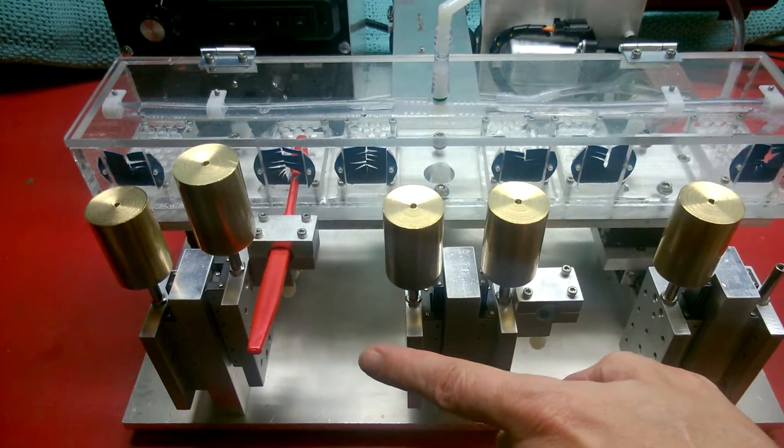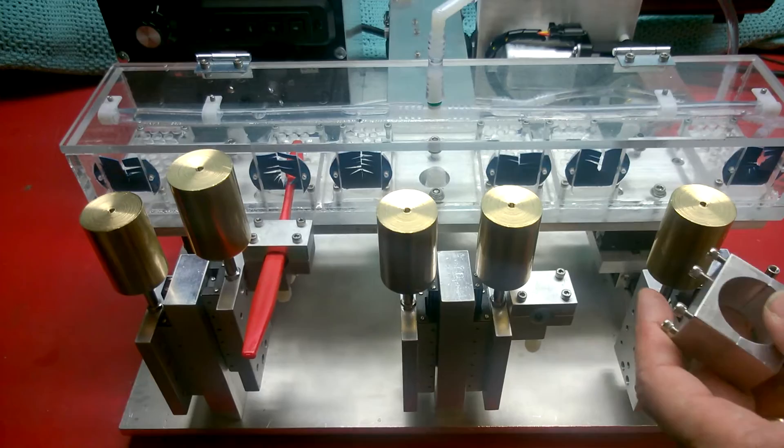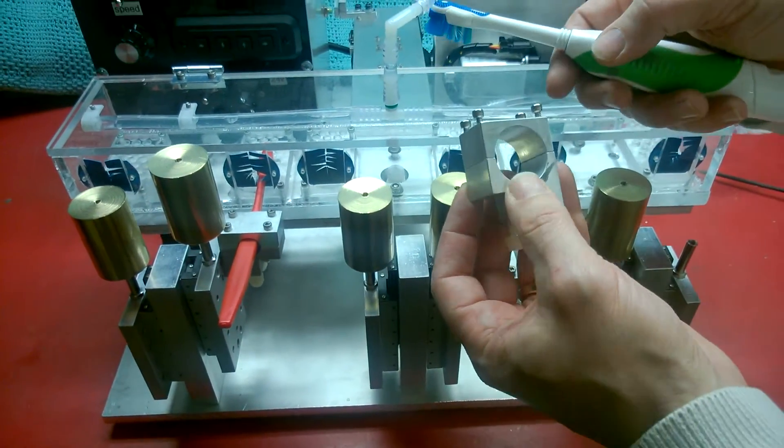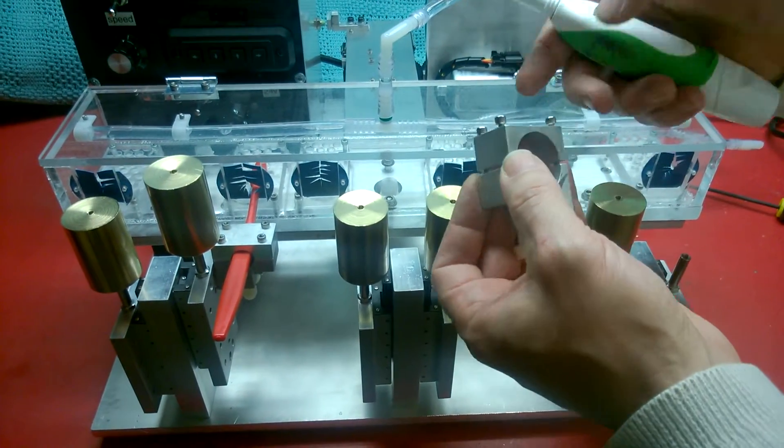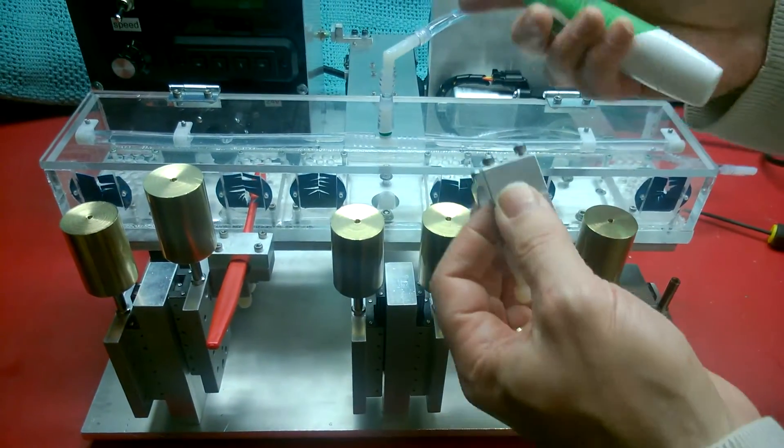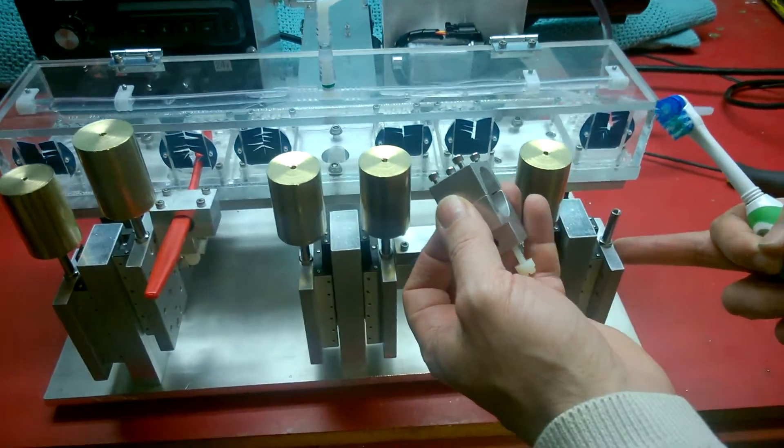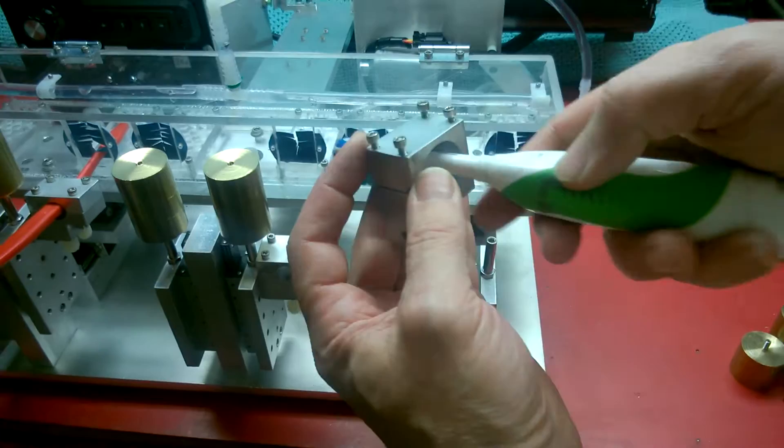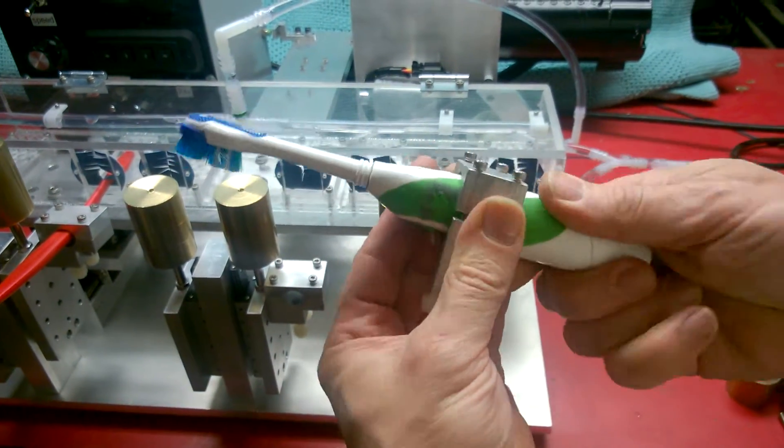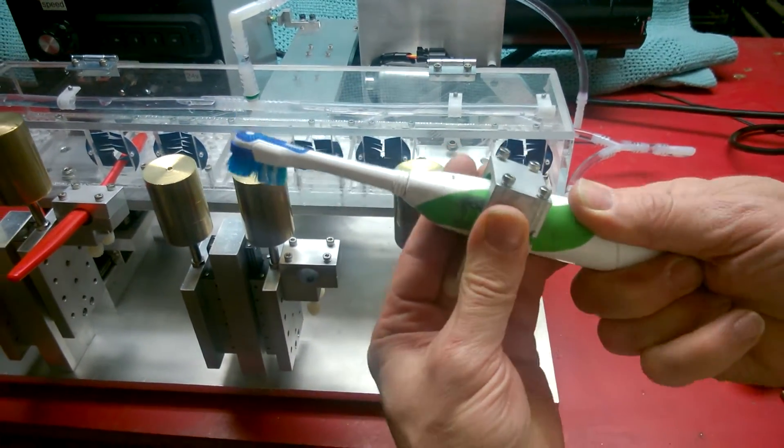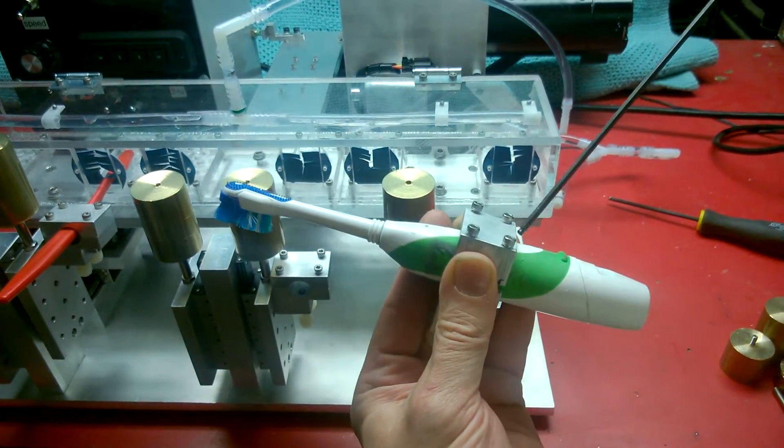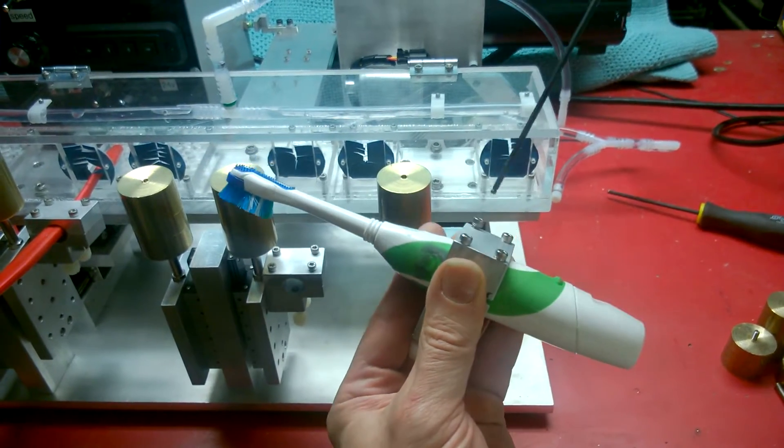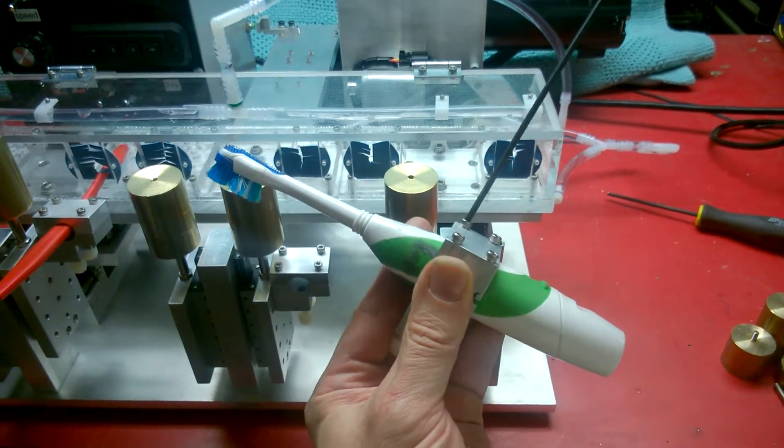As you can see, we're going to demonstrate mounting a powered toothbrush in its larger clamp. This inch and an eighth is the maximum diameter, which is a pretty good sized brush. We're going to plant it in this holder over here, in this orientation. We're going to put the brush in there. I found that clamping it about that place is the right position to give the right exposure to the brush.